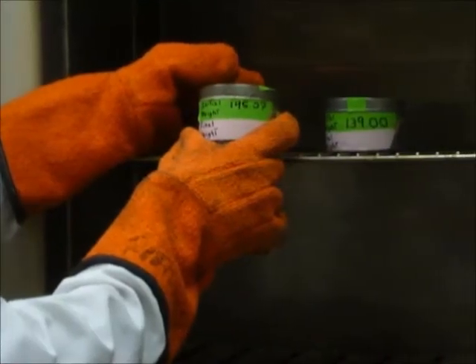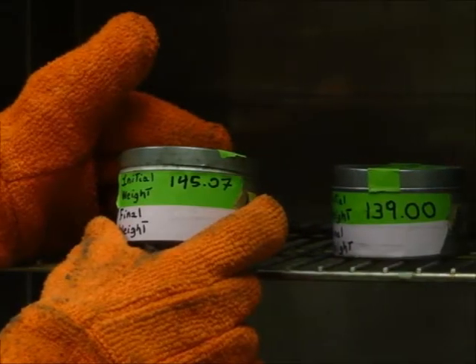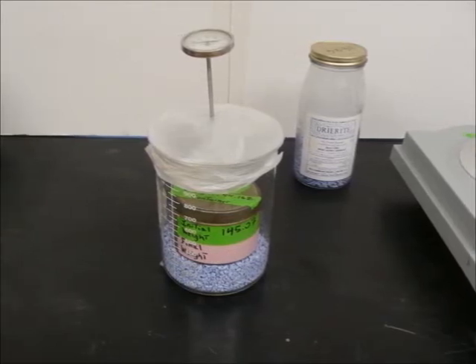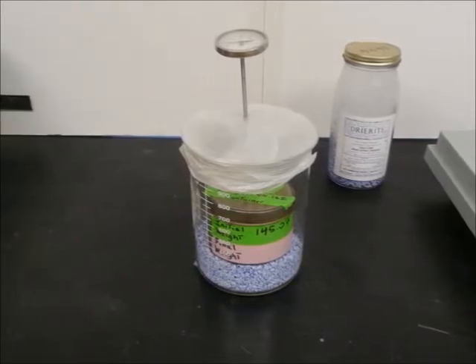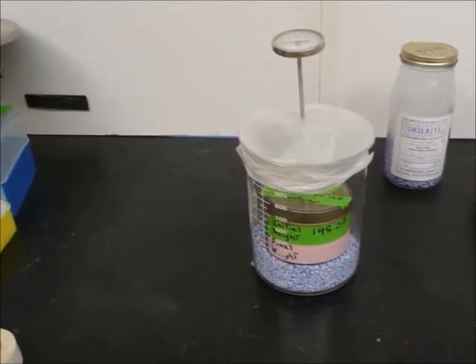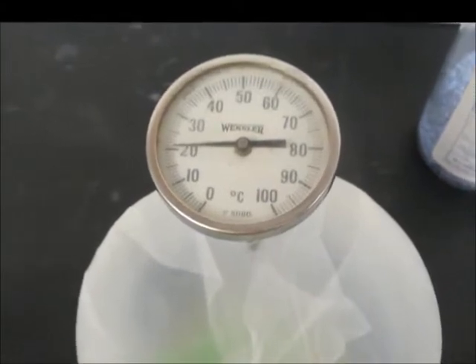Carefully remove the dried samples, place them in a desiccator, and allow to cool to room temperature before weighing the dried samples. If a desiccator is not available, one may be quickly created with a beaker, desiccant, parafilm, and a thermometer. First, place several centimeters of desiccant in the beaker, then place the dried soil sample inside, cover and seal with the parafilm, and finally carefully place a thermometer through the parafilm. When the sample is at room temperature, remove from the desiccator and weigh the sample for the final time.